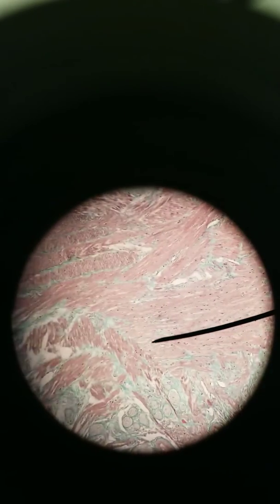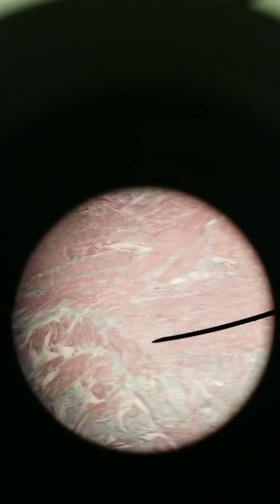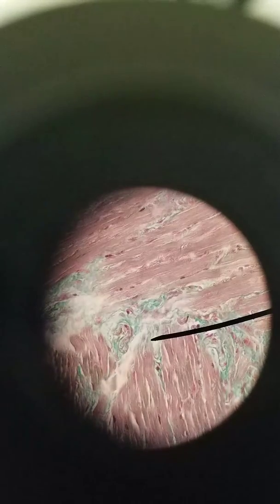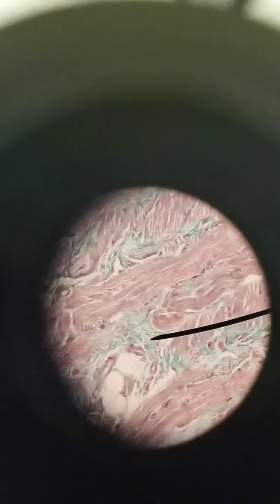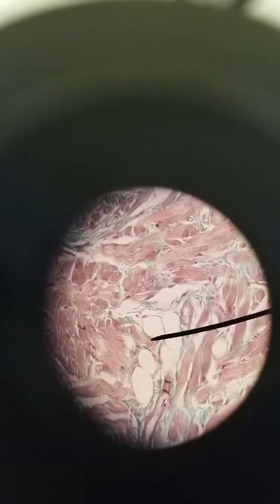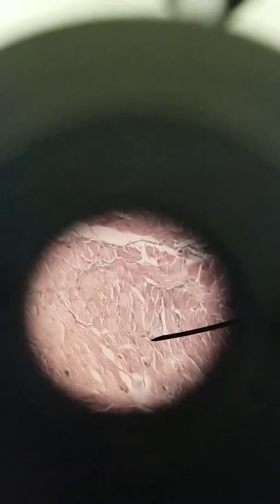Some of them are going longitudinally, back and forth, left to right like this. Some of them look a bit more round. That's because they're in cross section. Muscle fibers are very thin and long. So here is a very thin, long muscle fiber, or all of these are. And then these over here are a bit rounder because they're cut as cross sections. Don't mind the fat, that's fat in between. Here we go. These are rounder, they're more in cross section.